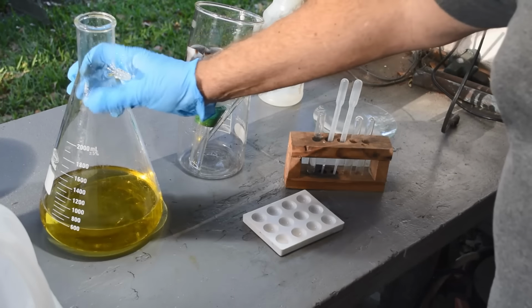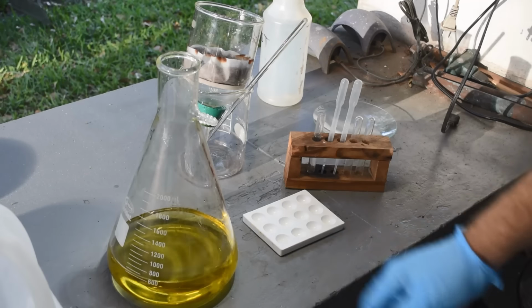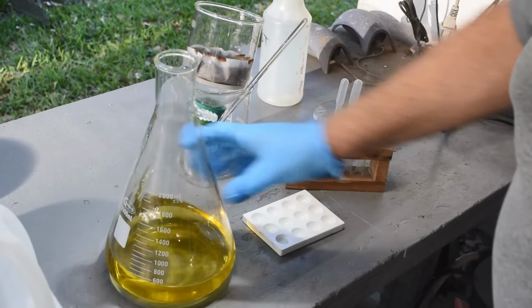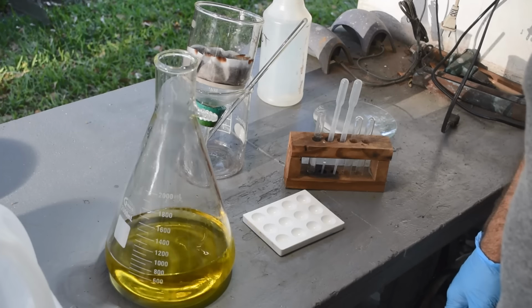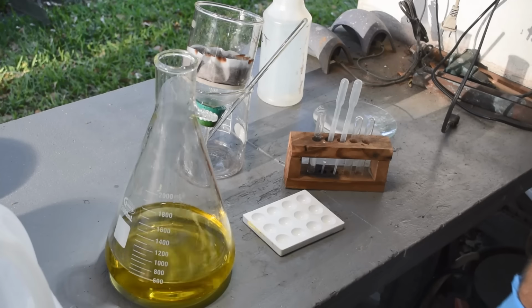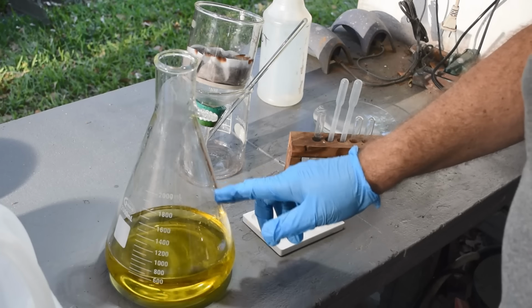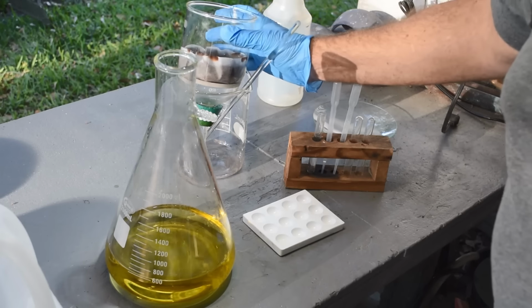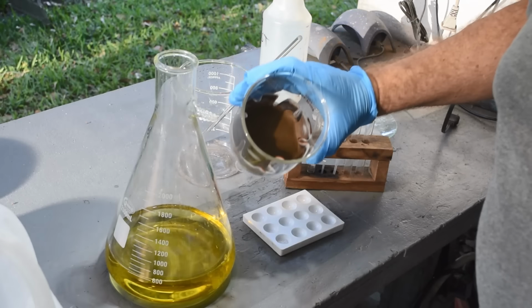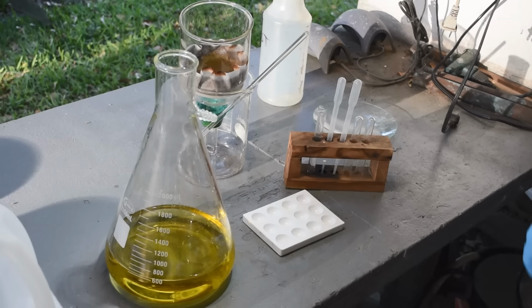Good. All right, so this is a waste product. It looks like it's got a lot of copper in it. Probably some other stuff too. But that will go in through my waste system, and whatever copper's in it will cement out on the iron I keep in my waste buckets. So I'm going to dump this out in my waste bucket, clean the flask, and then we'll be ready to dissolve the mud that's left in here, which should be gold now, in Aqua Regia. So we'll do that next.